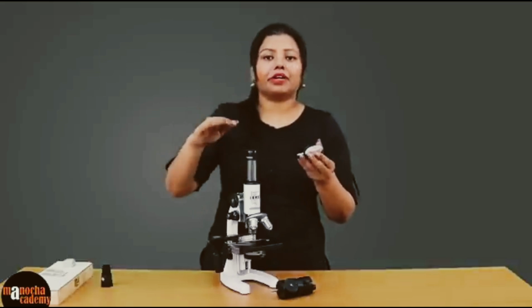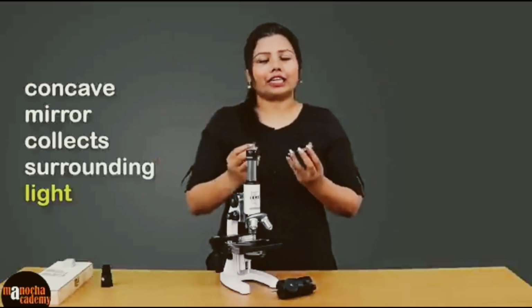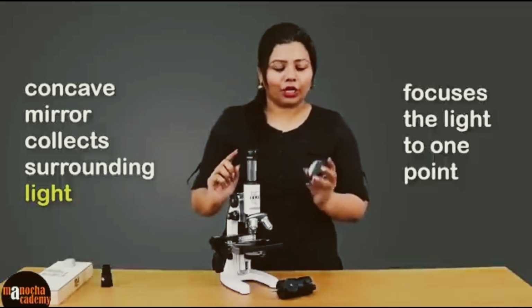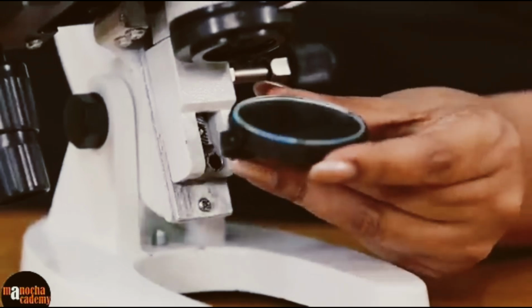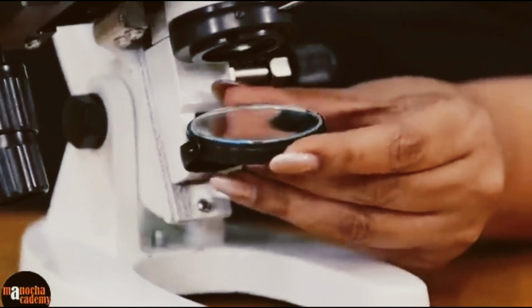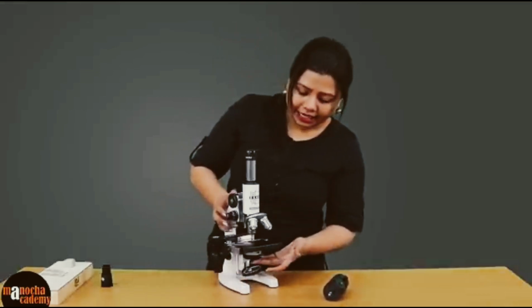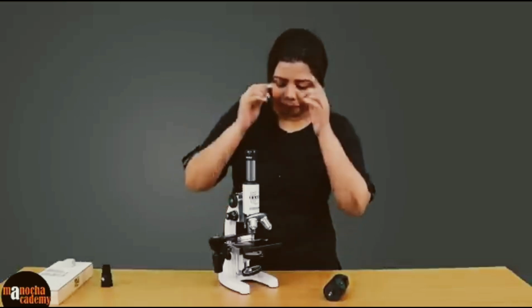The concave mirror, as you must be knowing, is responsible for collecting light from different directions and focusing it to one point. So we use this mirror and we attach it here to the base of the microscope so that the mirror can collect light from different directions and send it onto the specimen.